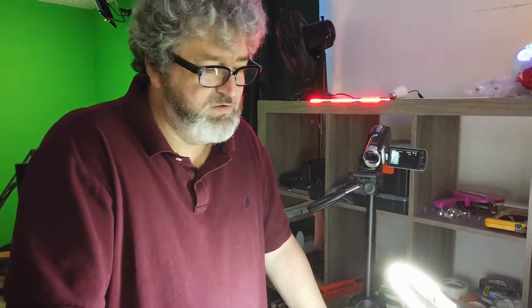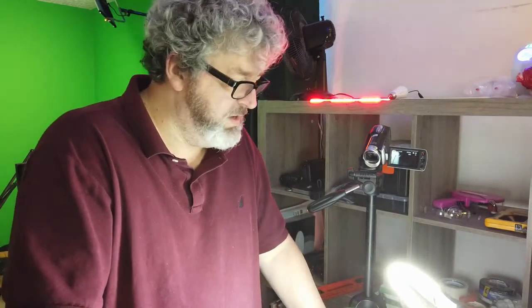All right, so we've used enough time here describing what we're going to do. So what I'm going to do right now is quickly finish off how I'm going to build this out, which is not much. I've decided I'm just going to make a little thing in the lip here, and we'll just be able to close it that way. And then we'll do our experiment, and we'll see what the results are, okay?